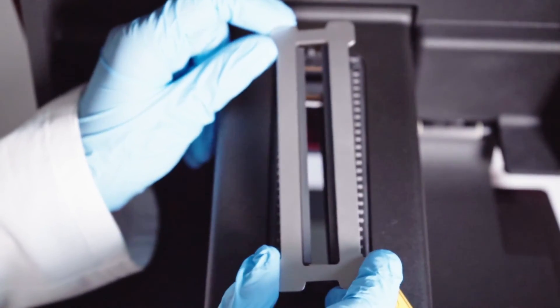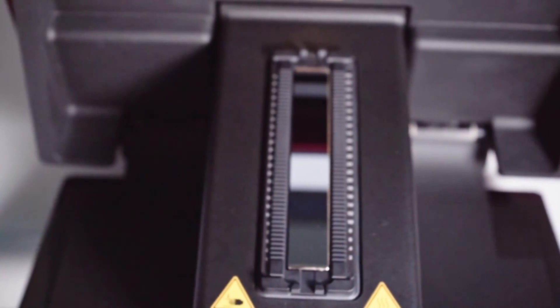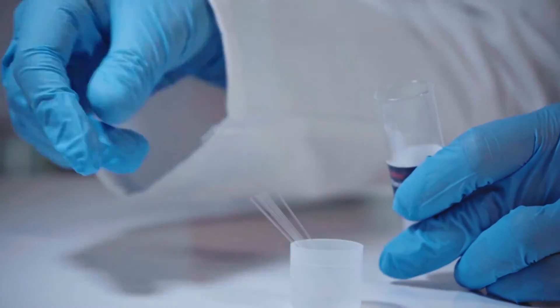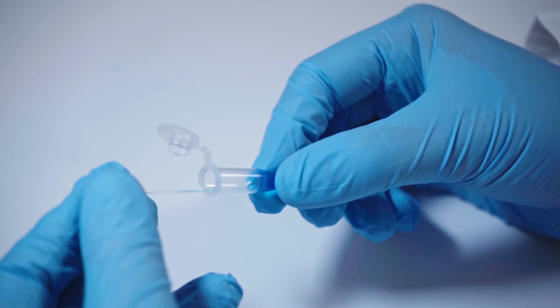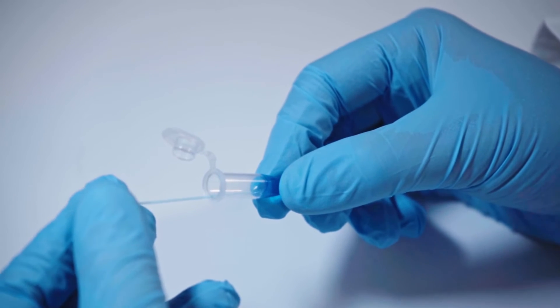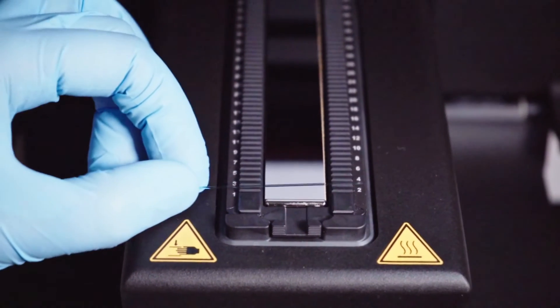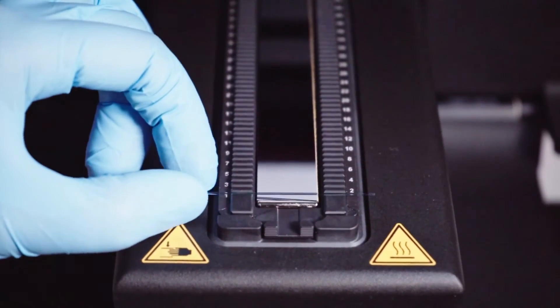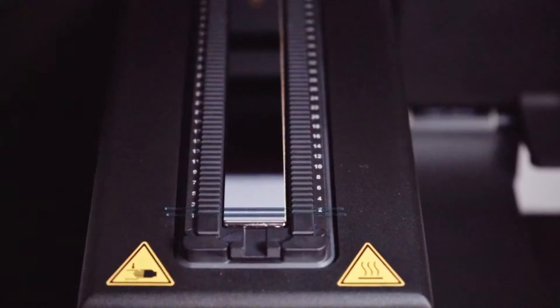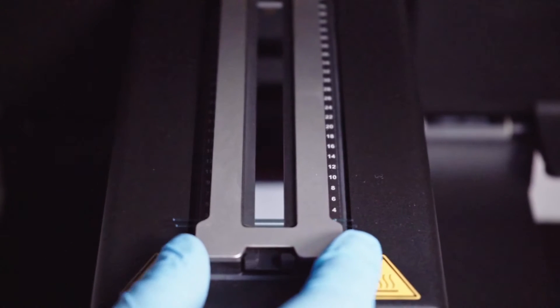Let's have a look at how to load your samples. There are two options depending on your experimental needs. The single capillary mode allows you to load up to 48 individual capillaries. Simply load your sample by dipping your capillary in your tube, then you can place it on the capillary tray. You can load as many samples as you'd like and then secure them with the magnetic lid. This magnetic lid will ensure that the capillaries stay in close contact with the heating element and ensures proper heat transfer throughout the whole experiment. This will provide the most accurate measurements possible.